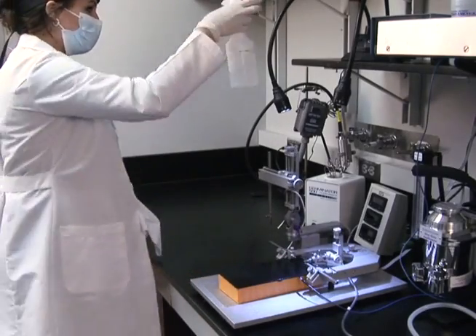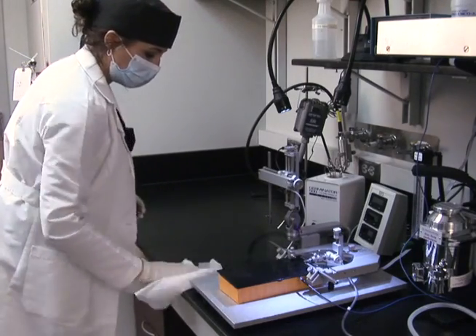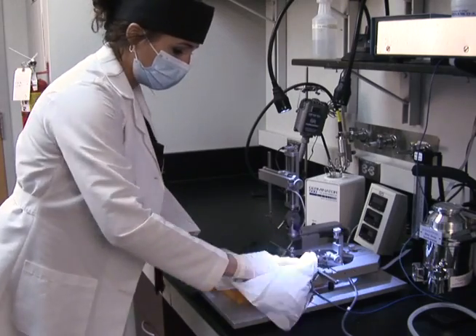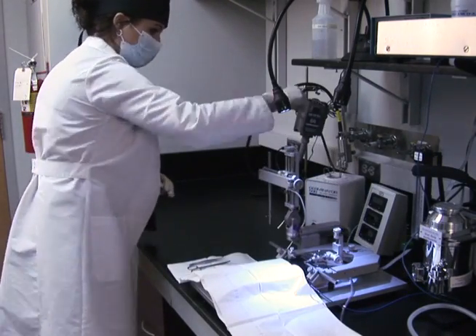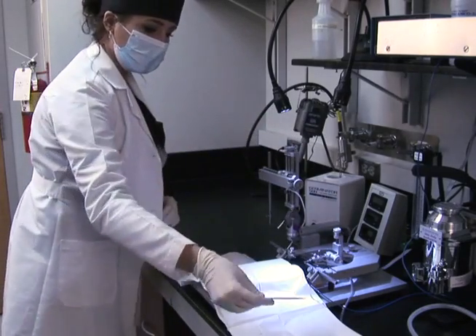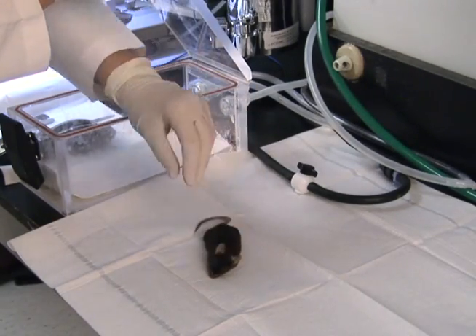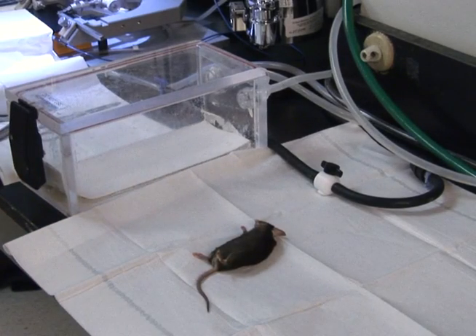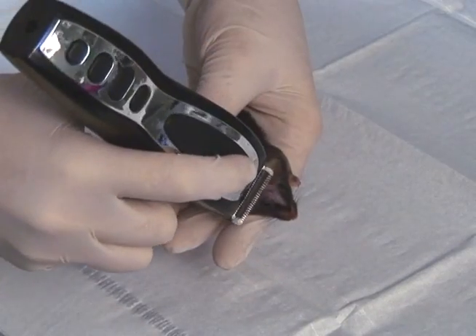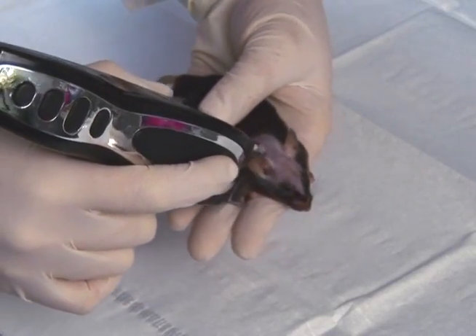All surgical procedures must be performed under sterile conditions using sterile equipment and solutions, and according to institution and government guidelines. Details can be found in the text protocol and the institutional IACUC guidelines. After anesthetizing the mouse in an induction chamber with isoflurane, remove the mouse and perform a toe pinch to ensure that the mouse is completely unconscious. Working quickly, shave the hair from the top of the shoulder up to in between the eyes.